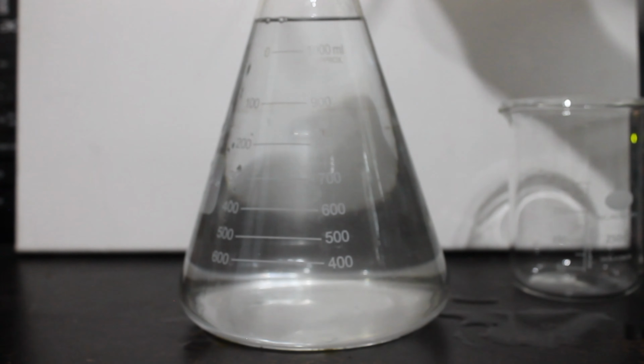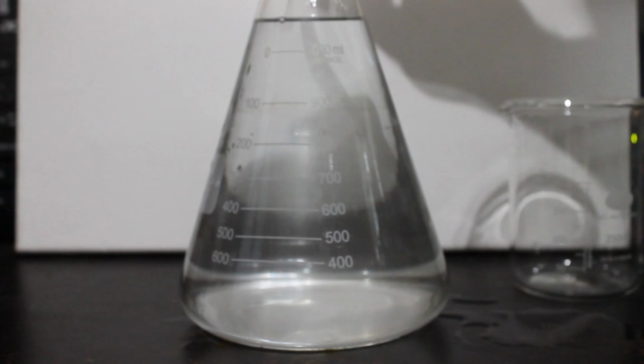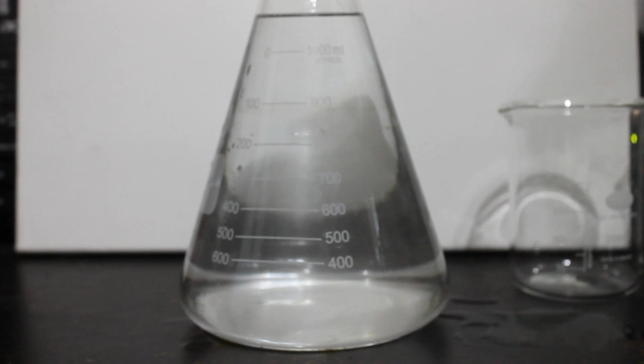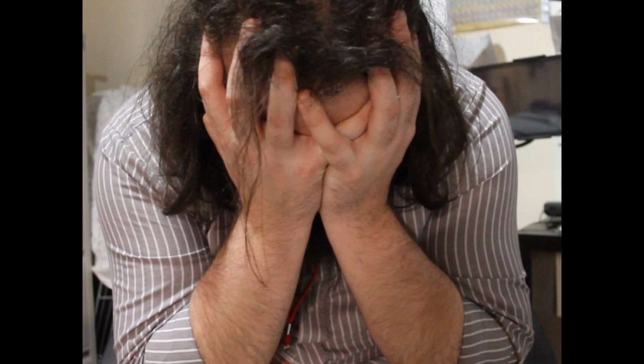I'm not entirely sure what went wrong, whether it was an issue with the reagents or a misinterpretation of the procedure. But either way, these things happen in science, and the only thing to do is deal with it like a dignified adult scientist, and then move on to Plan B, a different sort of chemical clock with a twist.